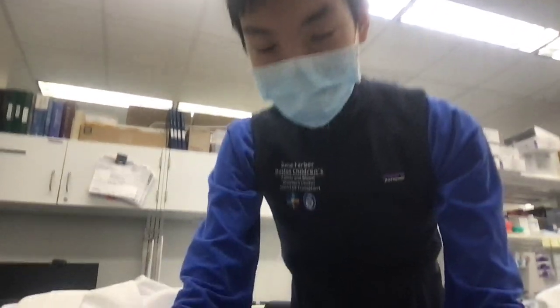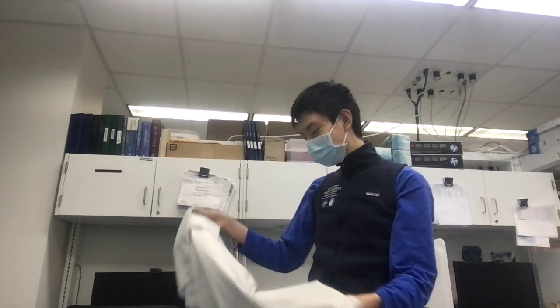Actually, let's first talk about some general lab stuff. In any sort of lab, it's very common to have personal protective equipment, and that would commonly include a lab coat. So I'm going to put on a lab coat.